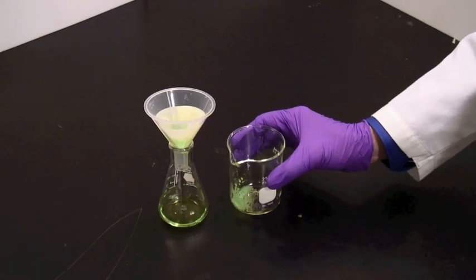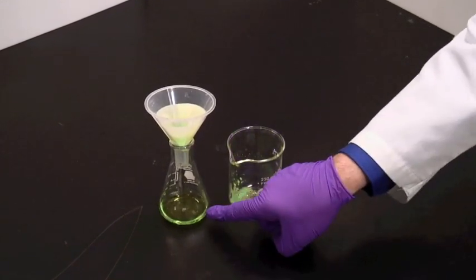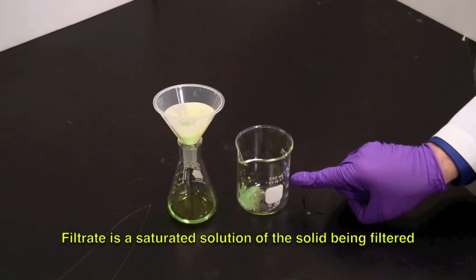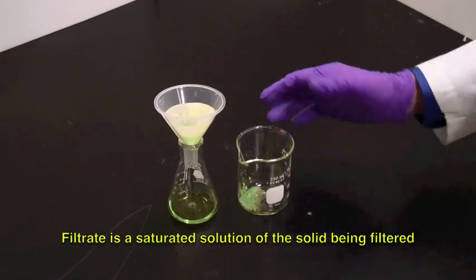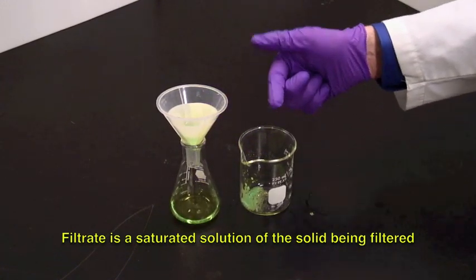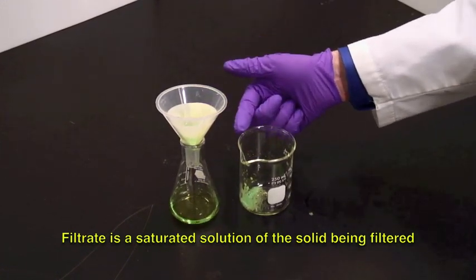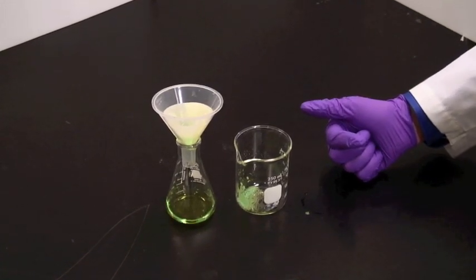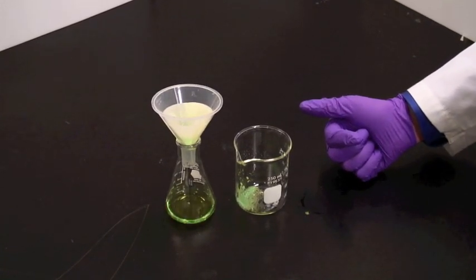The best liquid to use is, in fact, this one right here. The filtrate is already a saturated solution of my solid, and so if I transfer it here, I'm not going to lose any of the solid into solution as I would if I was using fresh water or fresh solvent.